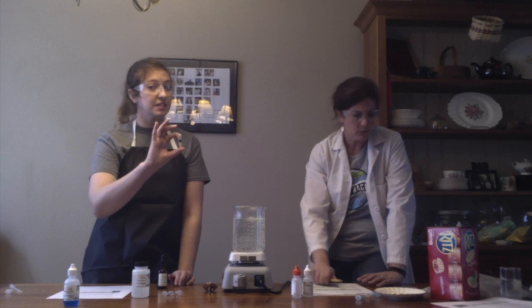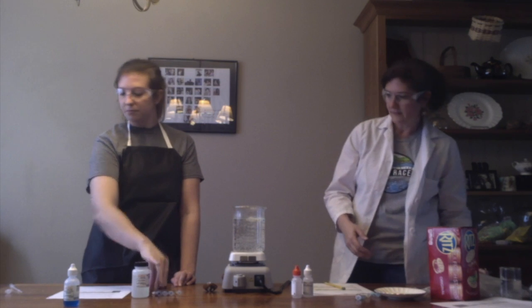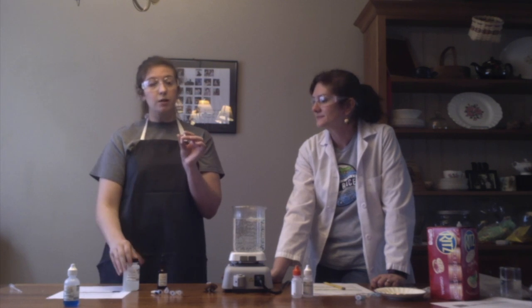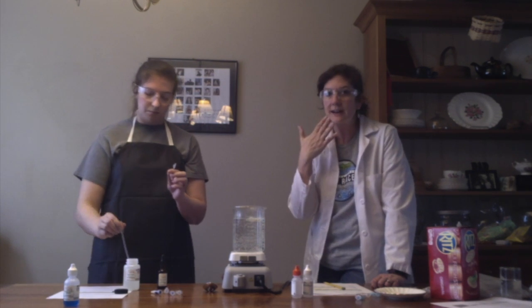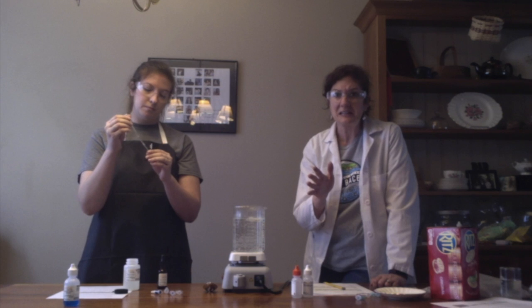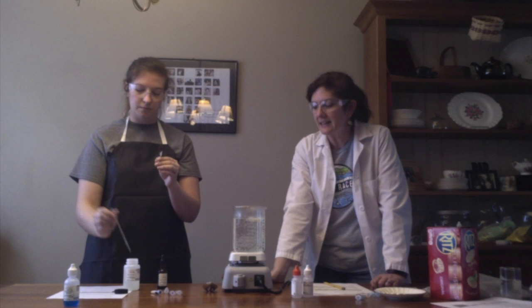I already see up at the top that it's become purpley brown. So there's definitely starch detected. That's cool. I'm going to take a picture. Now this last one is going to have the cracker and the water, but we're also going to add our alpha amylase enzyme again. Adding that amylase enzyme simulates what would happen if you chewed up the cracker and spit into the tube. We don't want to be so unhygienic, and we don't want to contribute our DNA to the lab, so we're going to use this manufactured amylase, but it does the same thing as the enzyme in your mouth.